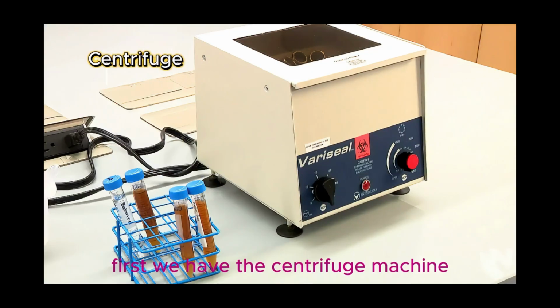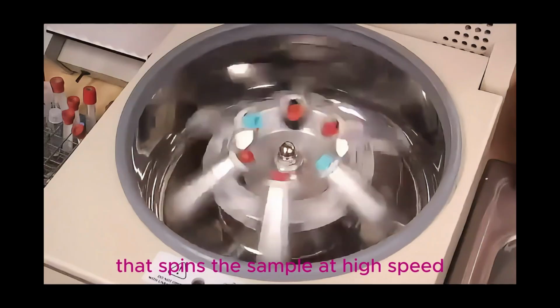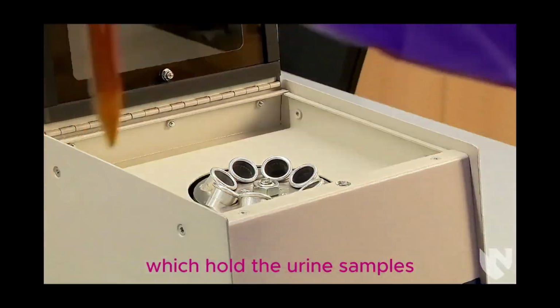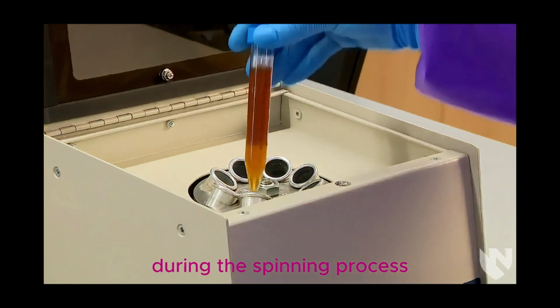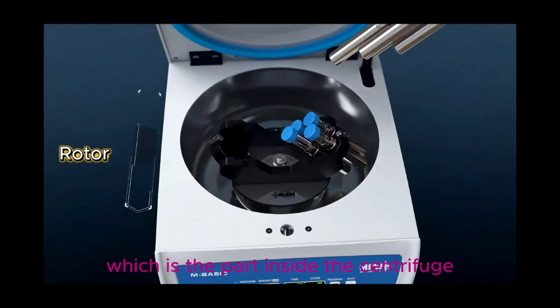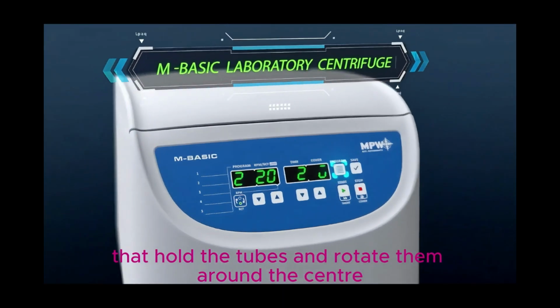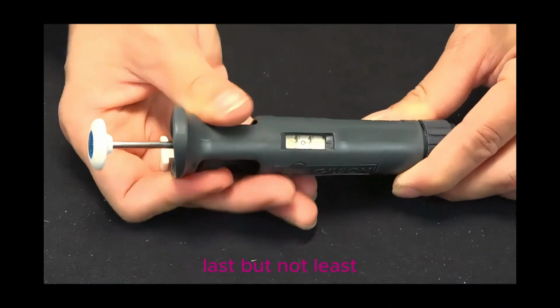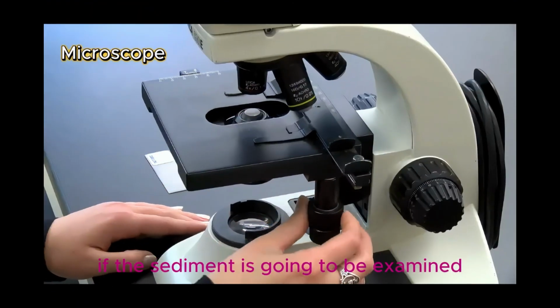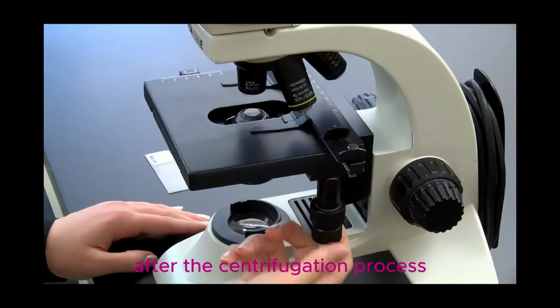First, we have the centrifuge machine, which is the main instrument that spins the sample at high speed. Next are the centrifuge tubes, which hold the urine samples during the spinning process. Another important component is the rotor, which is the part inside the centrifuge that holds the tubes and rotates them around the center. Last but not least, we also need a pipette and also a microscope if the sediment is going to be examined after the centrifugation process.